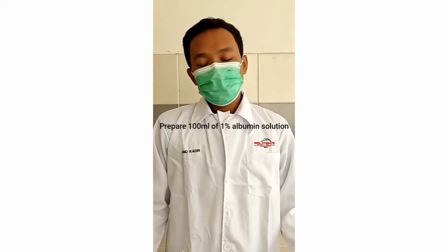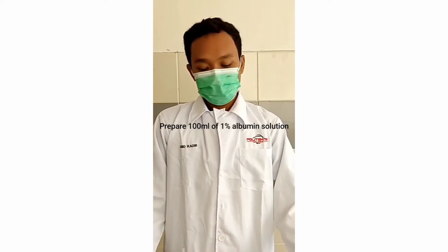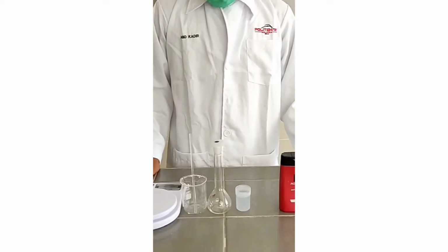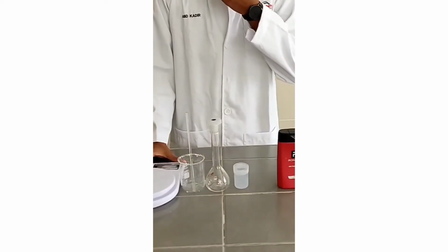Okay, now we will do the experiment: how to prepare 100 ml of 1% albumin. Now we will introduce the apparatus and material.